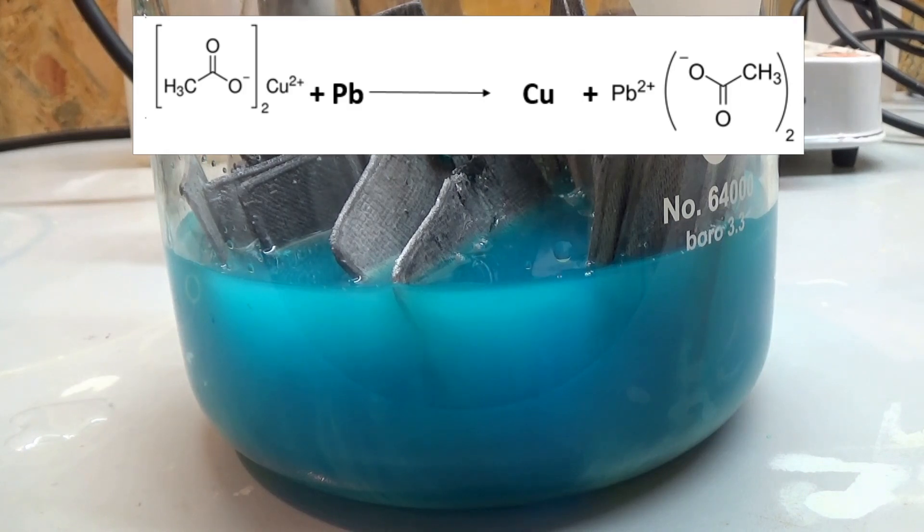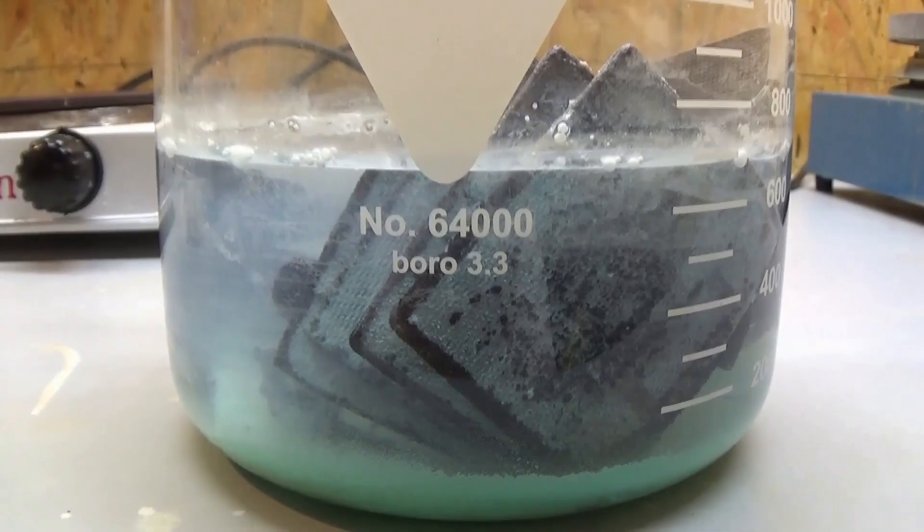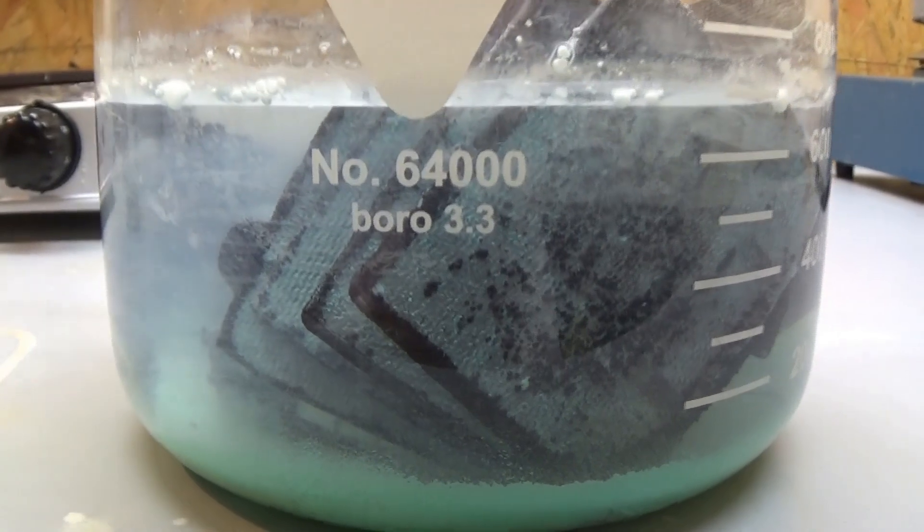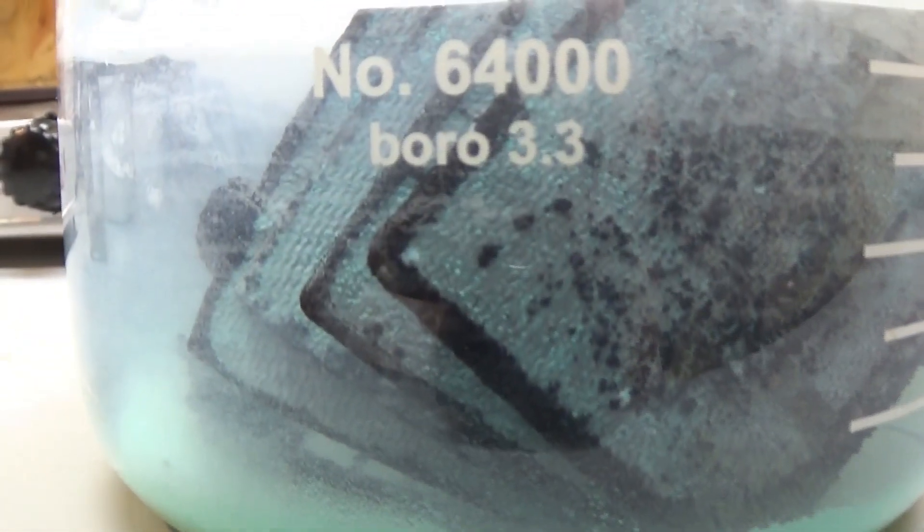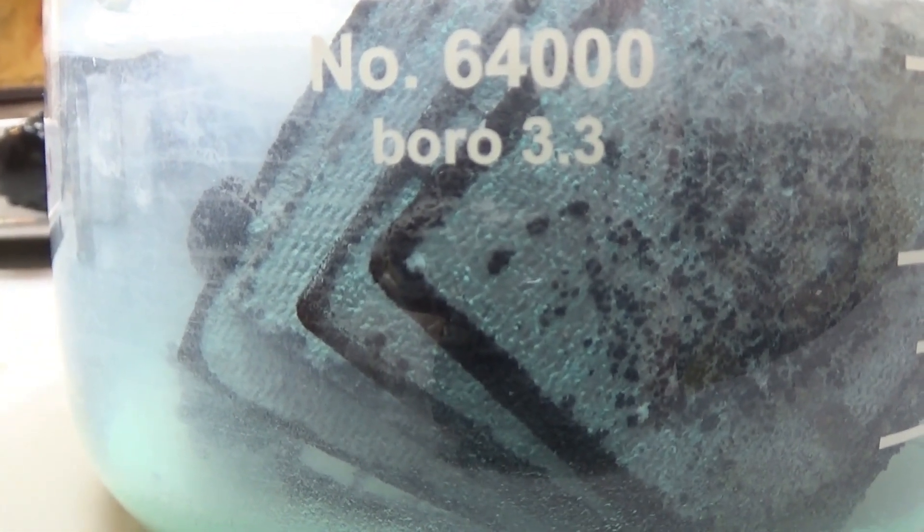The reaction is finished when the solution has all cleared up. This is due to the copper ions being reduced to elemental copper, which has no blue color like most copper salts.